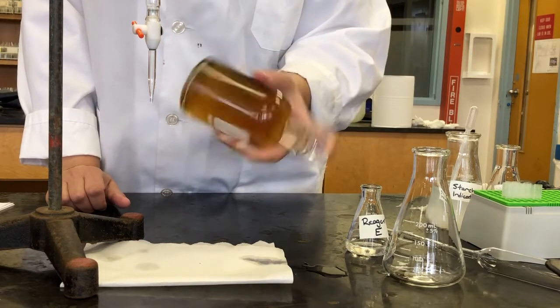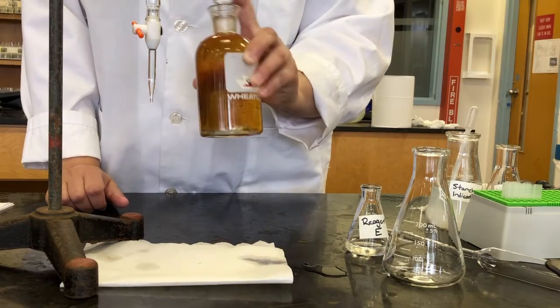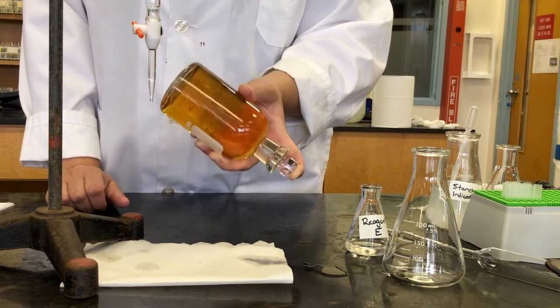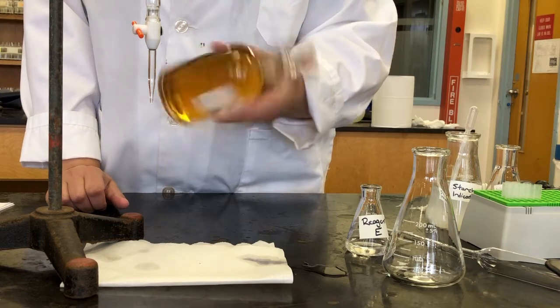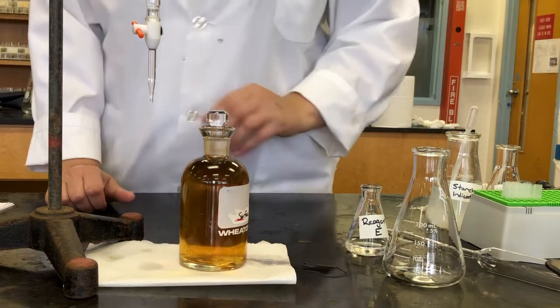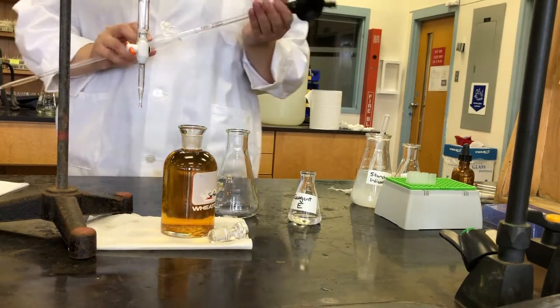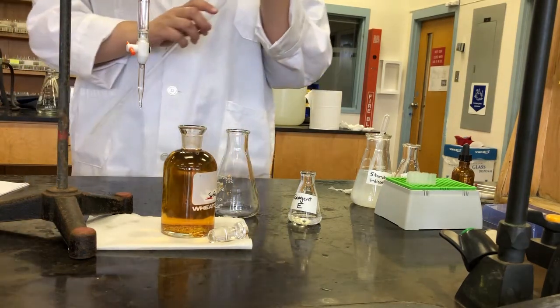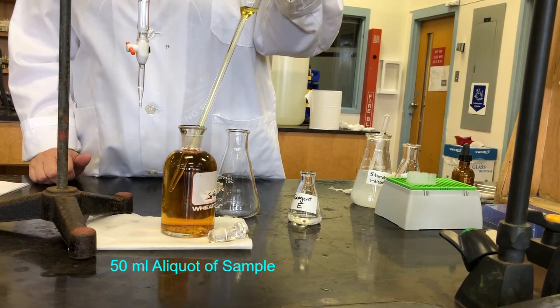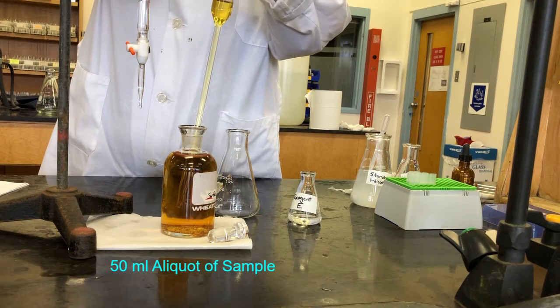And we should see, like we saw last week, that the precipitate dissolves and we're left with a yellowish solution. Okay, so you can see now that our precipitate has all dissolved. We're left with a yellowish orange solution. So now we're going to take a 50 ml aliquot of that and put it in an Erlenmeyer flask for the titration.